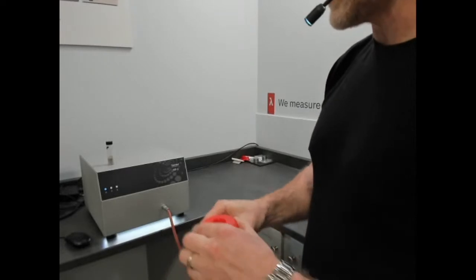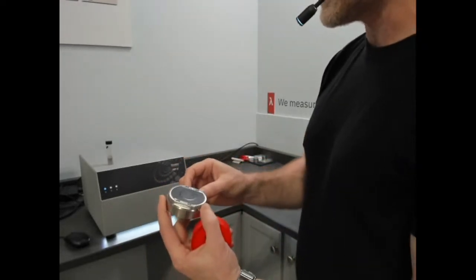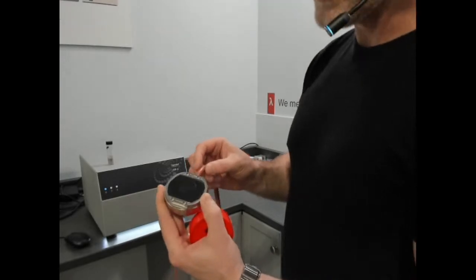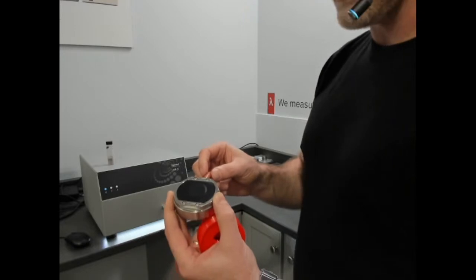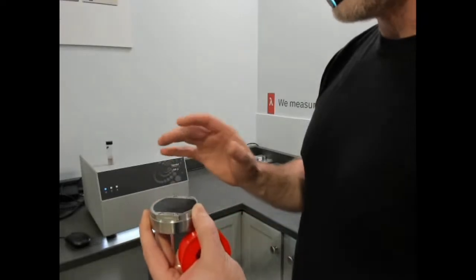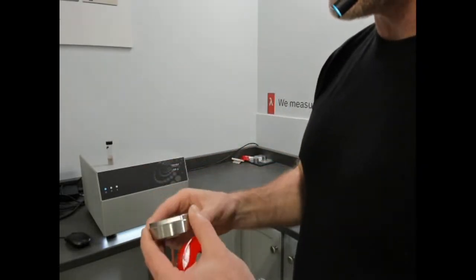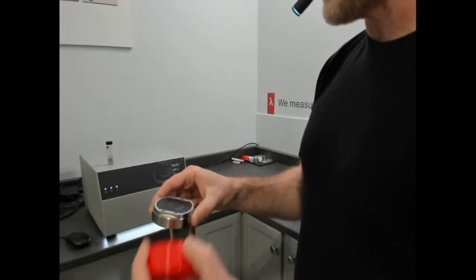Now, why we call this an MTPS sensor is that it is a permanently assembled single-sided or asymmetric transient plane source sensor, following the same theory described in ISO 22007-2 for thermal conductivity, thermal diffusivity, and specific heat. What is unique about this one, it's permanently assembled and validated and really designed to be convenient, but with all the capability of the symmetric or ISO.